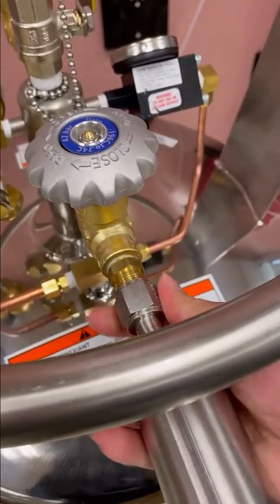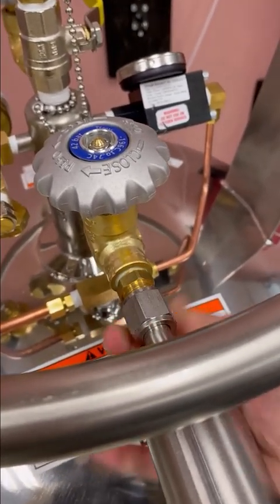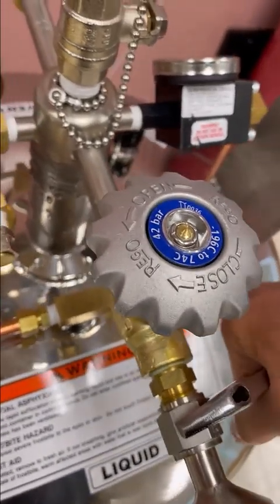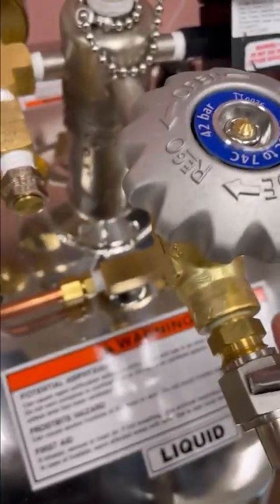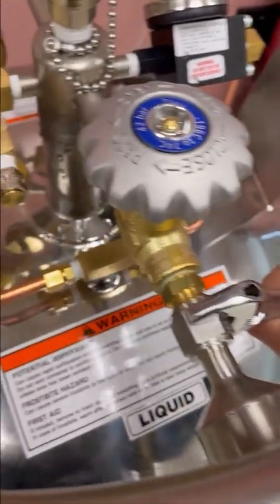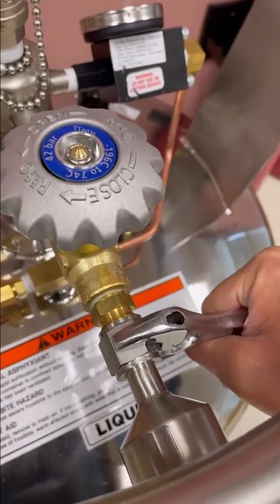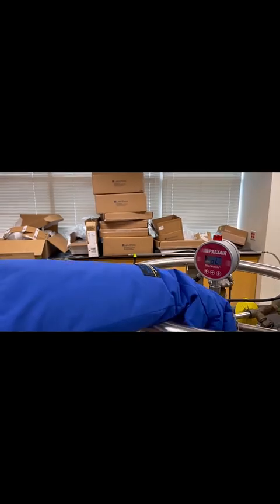Rotate this one clockwise. I will also use a wrench to help tighten it, and you might want to wiggle this a little bit so that it's connected in the right place. Later, when we flow the liquid nitrogen, due to thermal contraction and thermal expansion mismatch, we need to tighten it one more time.